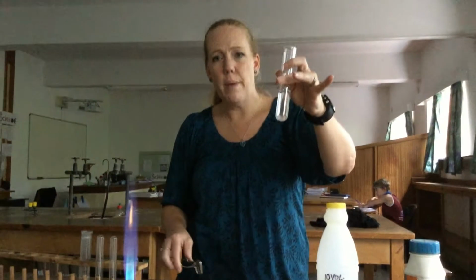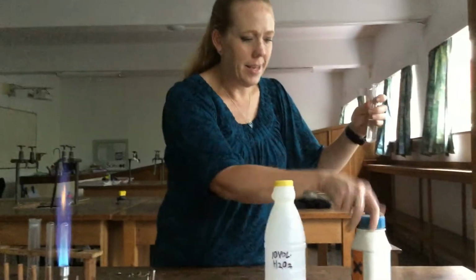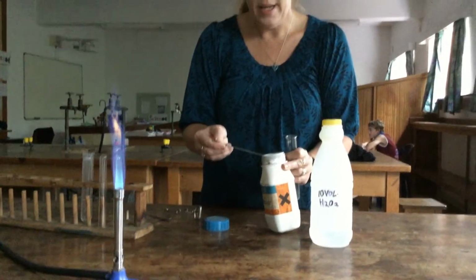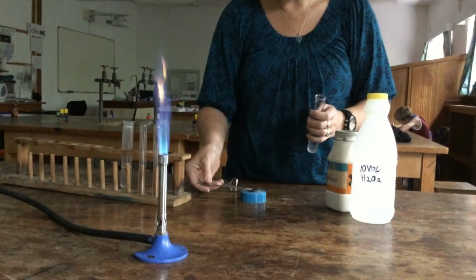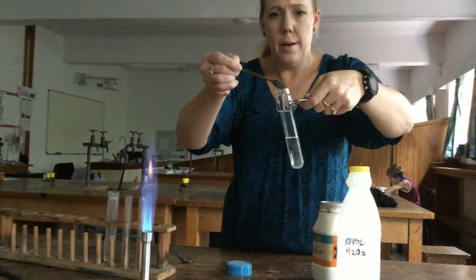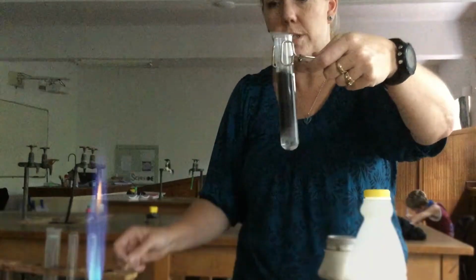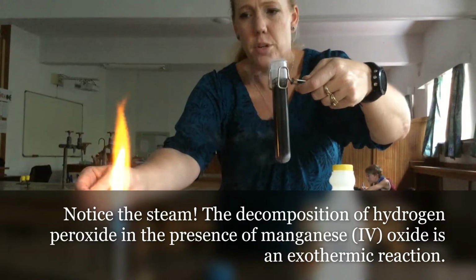This time I've got some hydrogen peroxide in my boiling tube, and I'm going to add a catalyst. The catalyst in this situation is manganese dioxide. This black powder is insoluble, it won't dissolve, but you should see bubbles of oxygen being produced. There I'm putting in my manganese dioxide, and look carefully, you should be able to see that bubbles of oxygen are being produced.